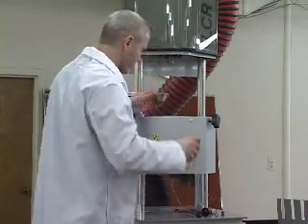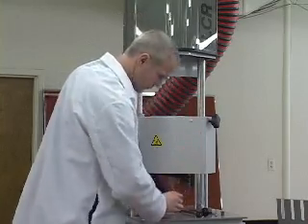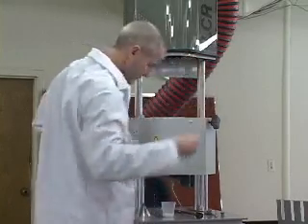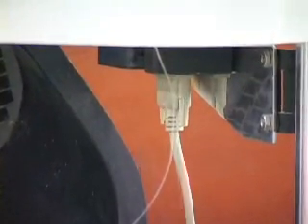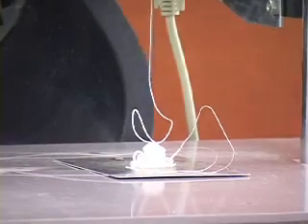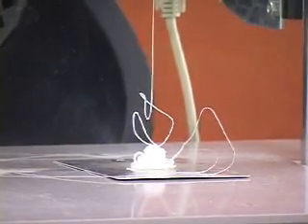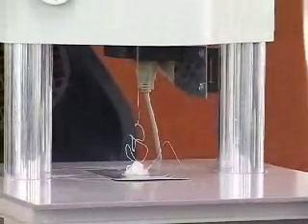To perform the test, a plastic sample in the form of pellets or particles is placed in the barrel and allowed to melt for a specified period of time. For viscosity versus shear rate data, at the end of the melt period, the sample is extruded through the capillary at multiple shear rates, typically from highest to lowest, and the viscosity is recorded at each shear rate. The data is recorded, and a viscosity versus shear rate curve is generated.